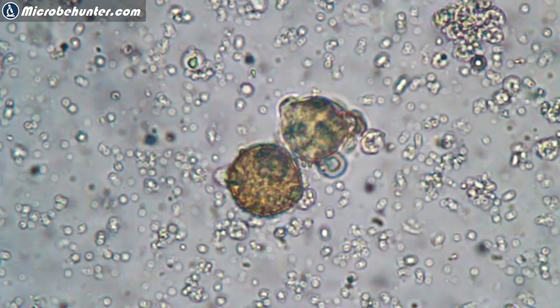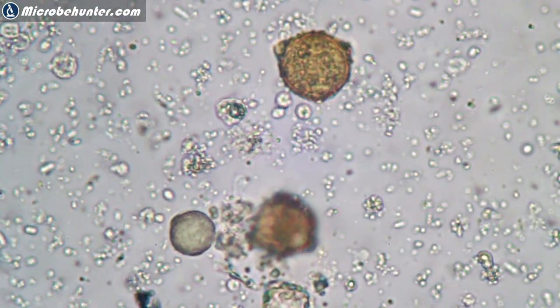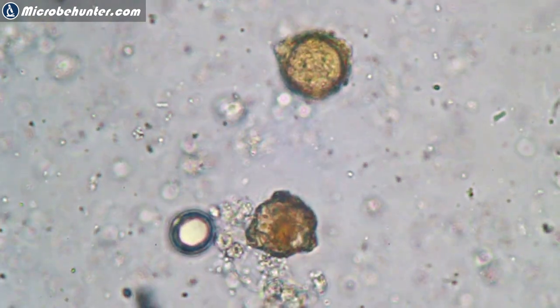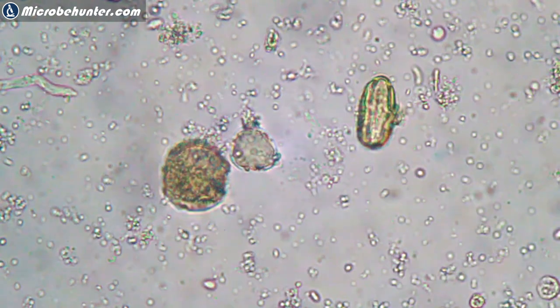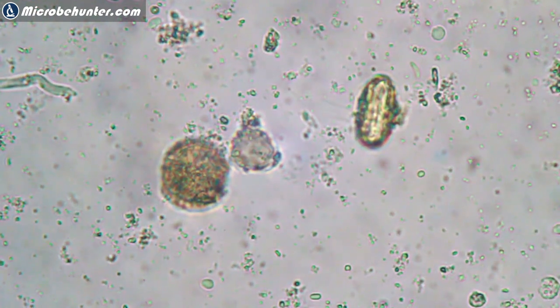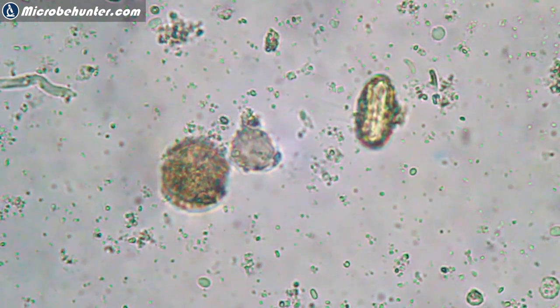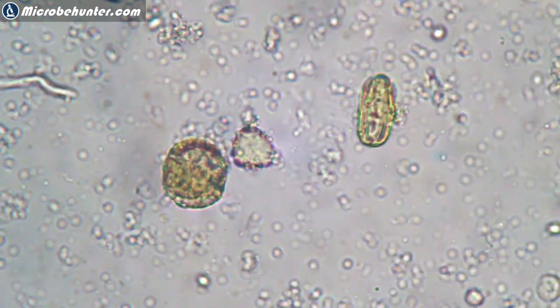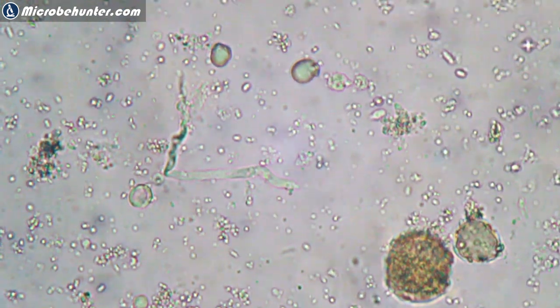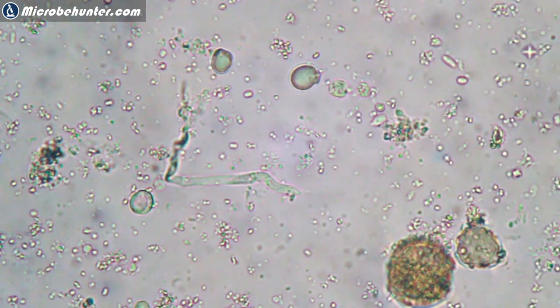But there are a whole bunch of other things floating around. Could they be bacteria? Could be. In any case, the first test immediately worked without any problems. So you can see that centrifugation is indeed a thing that allows you to easily concentrate suspended particles — pollen, bacteria, maybe also some ciliates and other water organisms, algae, single-celled algae maybe. There are quite a lot of possibilities here. The next couple of weeks and months I'm going to try out a few more of these things and see what I can find, to expand the possibilities of the samples that you can observe under the microscope.